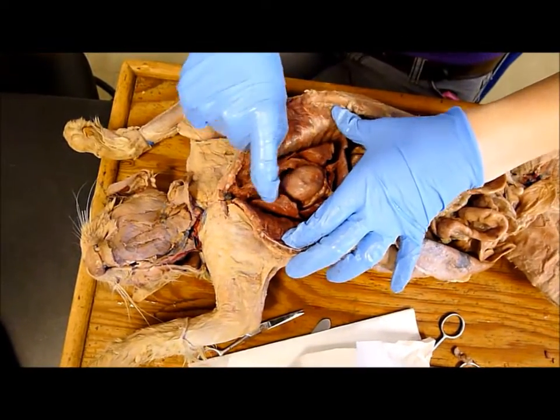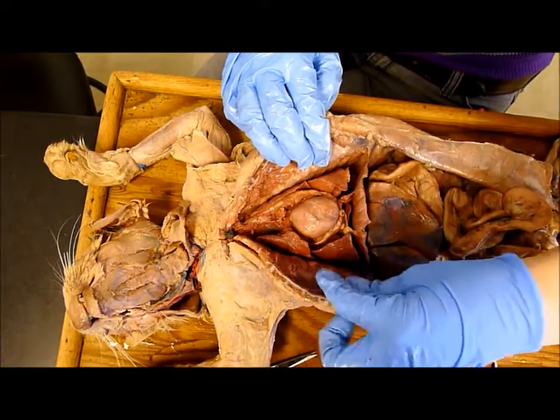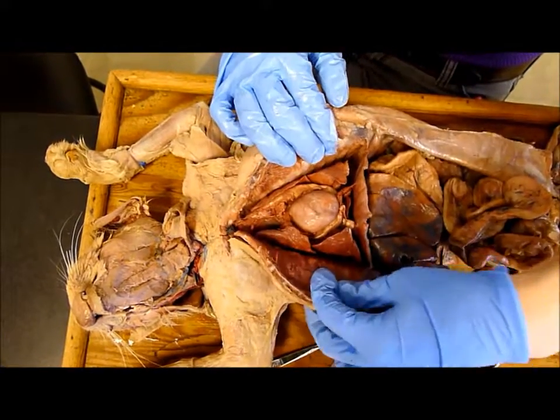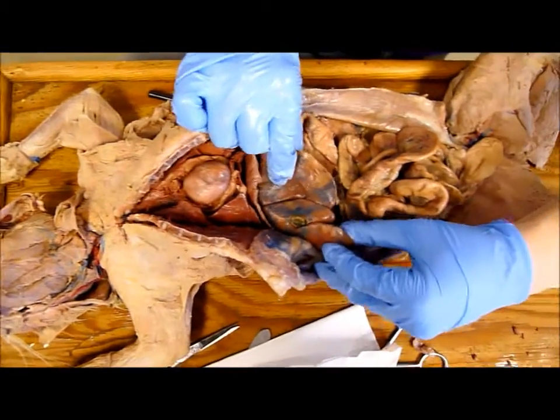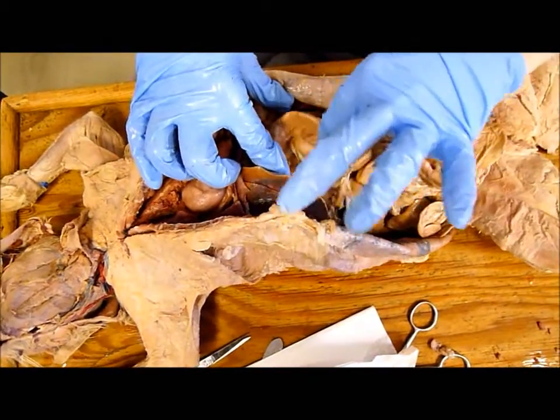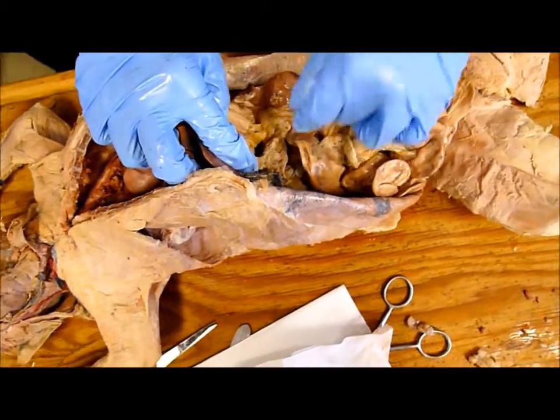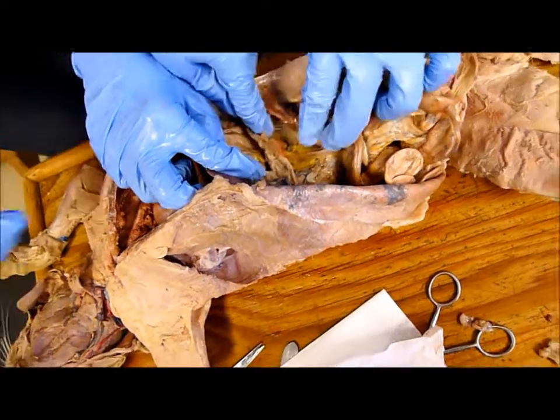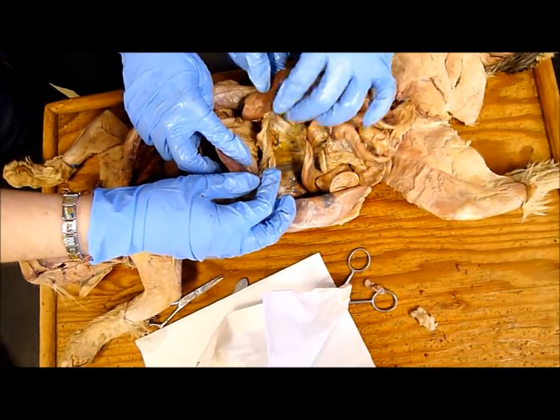This is the aorta, the main artery coming out of the heart. Then you can see the various lung lobes. You breathe with the diaphragm, which makes the lungs open and expand — you can see it's muscular, it has little striations on it. And then we got the liver, the little green gallbladder right there, the stomach underneath the liver, the spleen, and the pancreas — that nubbly, granular bit right there under the stomach.